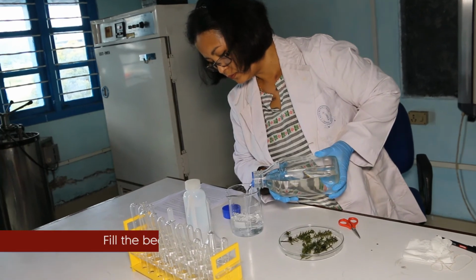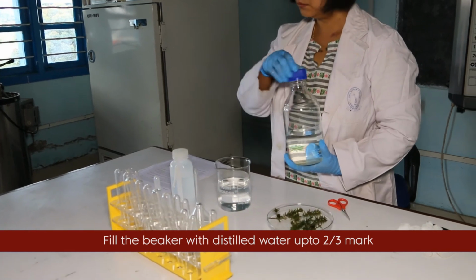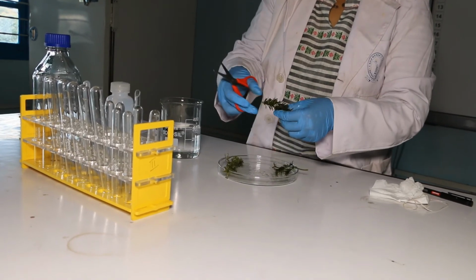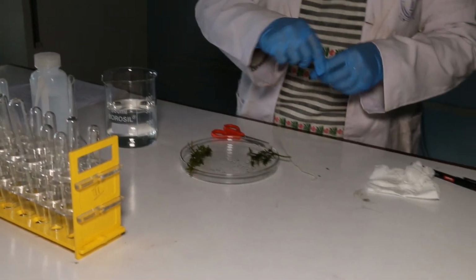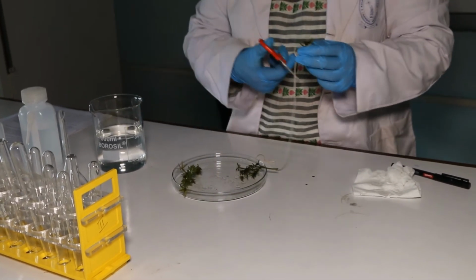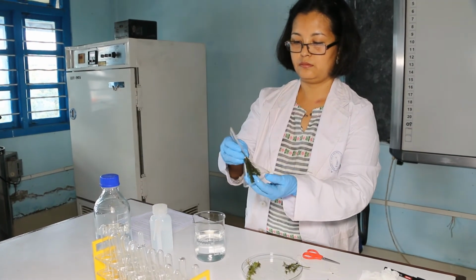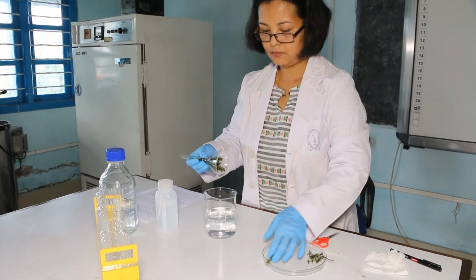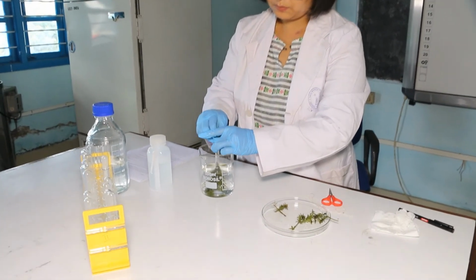Take a beaker and fill it with distilled water up to the 2/3 mark. Now take some fresh and healthy Hydrilla plants and cut their ends and tie them loosely with a thread. Insert the cut ends inside the neck of the funnel. Then the funnel is inverted inside the beaker, making sure that all the Hydrilla sprigs remain inside the funnel.